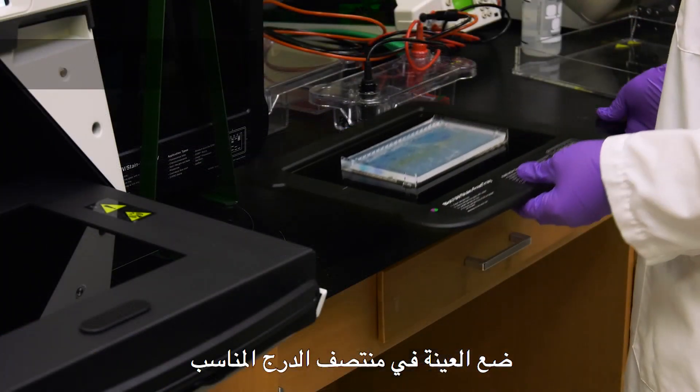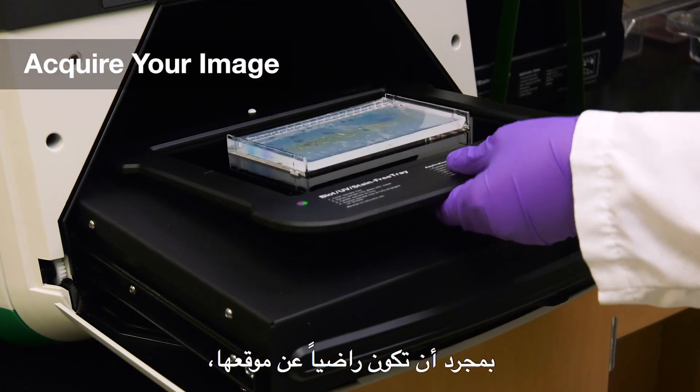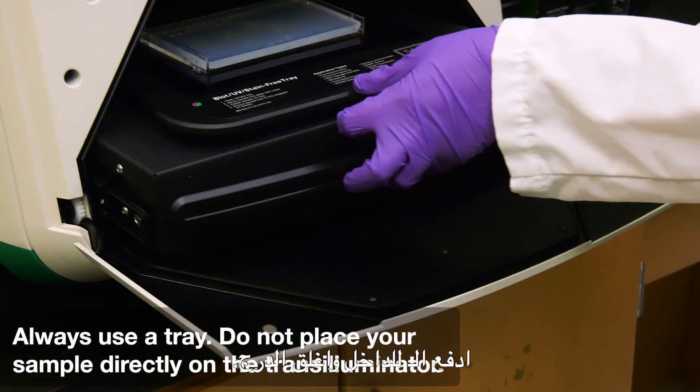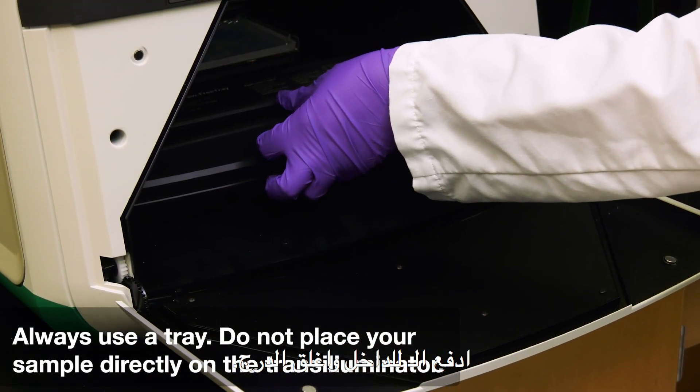Center your sample on the appropriate tray. Once you are satisfied with the position, push the transilluminator back in and close the drawer.